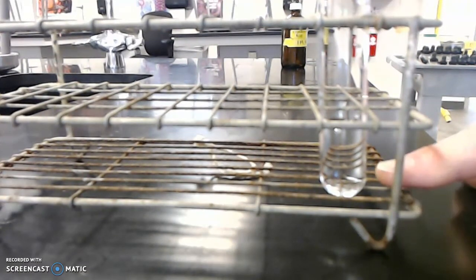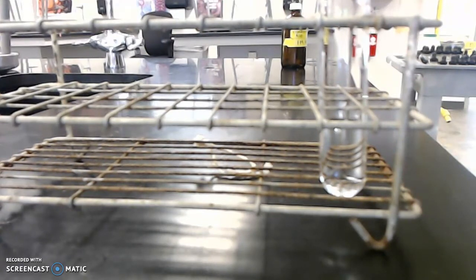So the key thing that you're watching right now is watch the liquid right there. I'm about to add some silver nitrate, except the cap is stuck. All right, now I got it off. Okay, so I've got a dropper, and I'm going to just drop some silver nitrate in. There's the first drop. Ooh, that's kind of cool. And let's do a couple more drops. Wow, the camera looks sort of like it's a slow motion camera. There's our third drop.